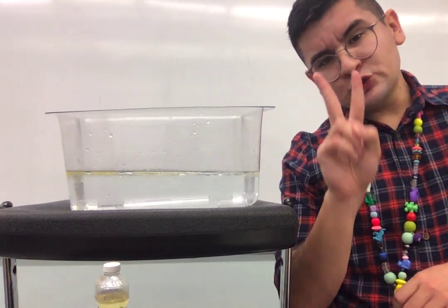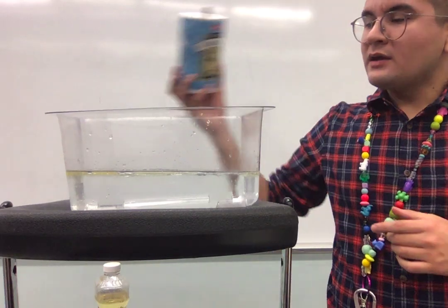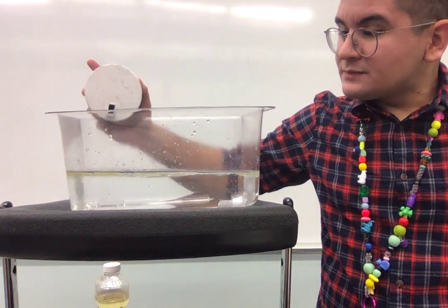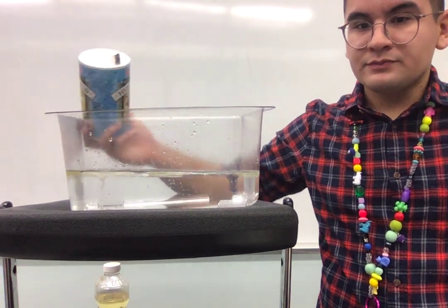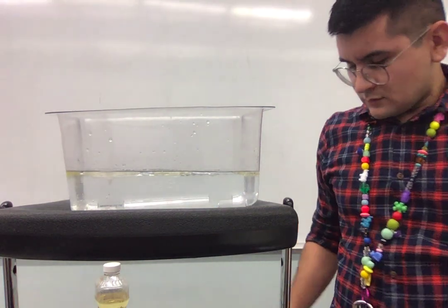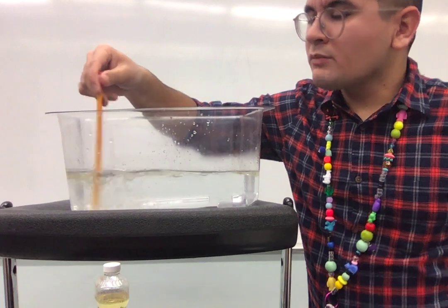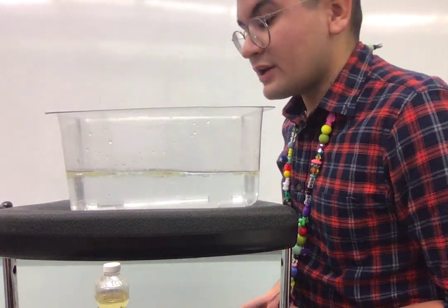And then we're going to try 2 more substances. The first substance we're going to use is salt. So I'm just going to pour it in there, see what happens. Let me mix it a little bit. Oh my goodness. Guess what, guys? I cannot see the salt in there anymore.